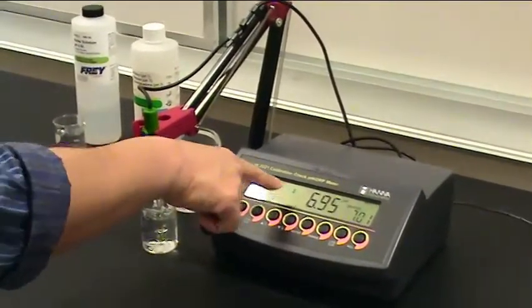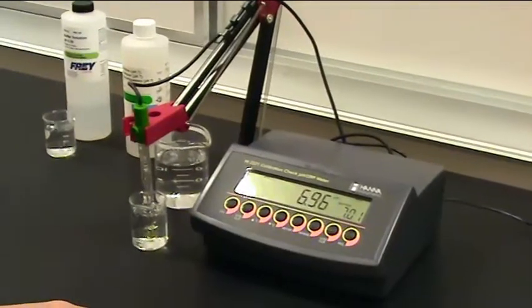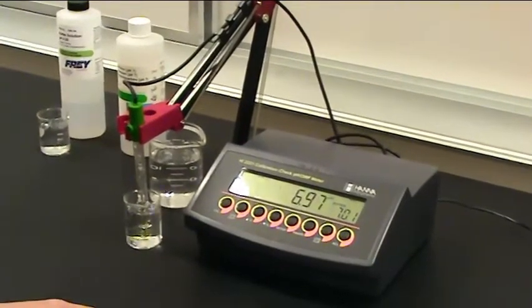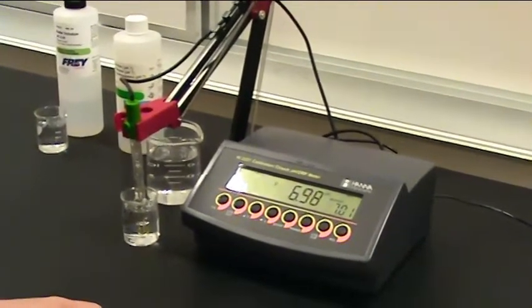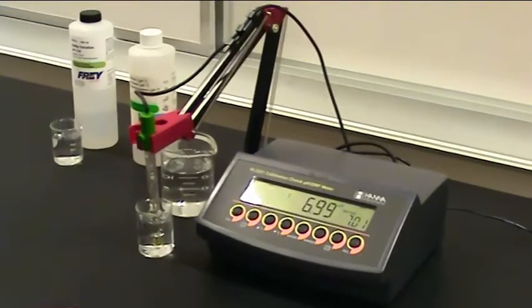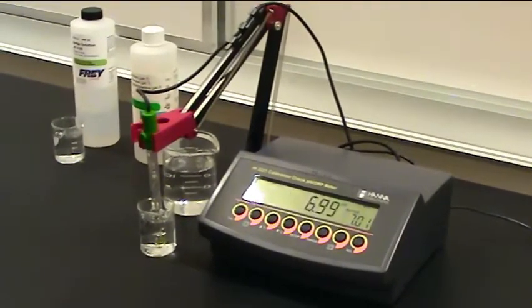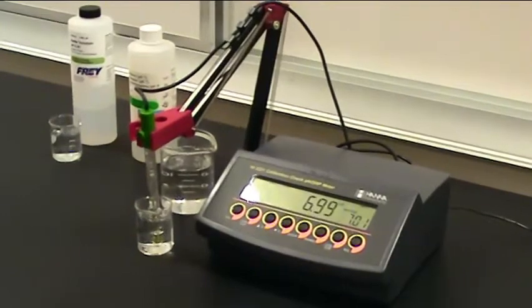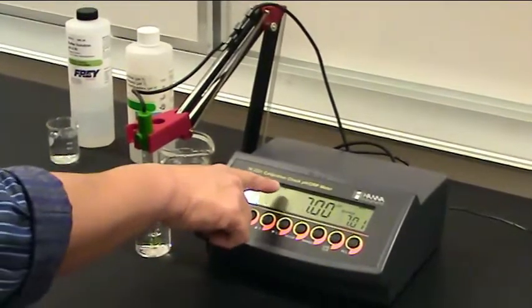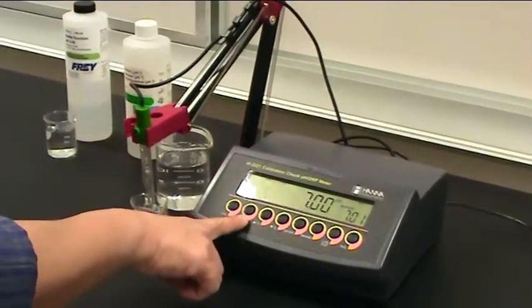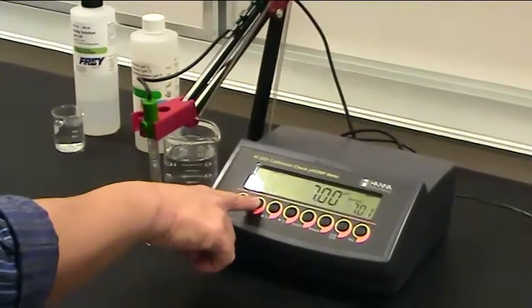And then you'll see the hourglass blink for a few moments. Once the probe has stabilized reading, it will ask you to confirm the reading. Sometimes this takes a few moments. There we go. The little flashing CFM will tell you to hit the confirm button to let it know that you can move on.